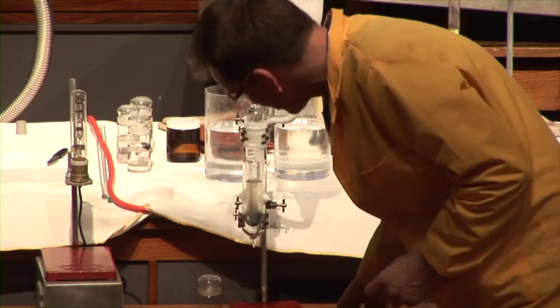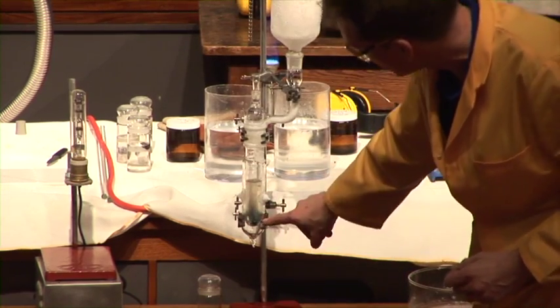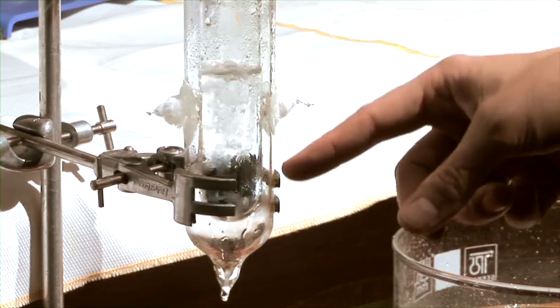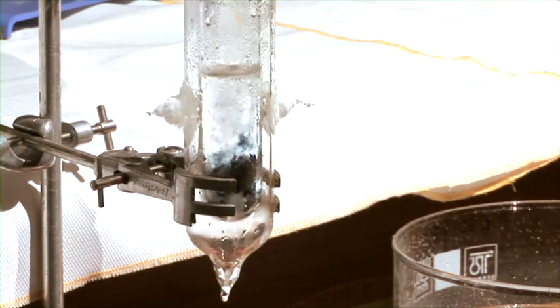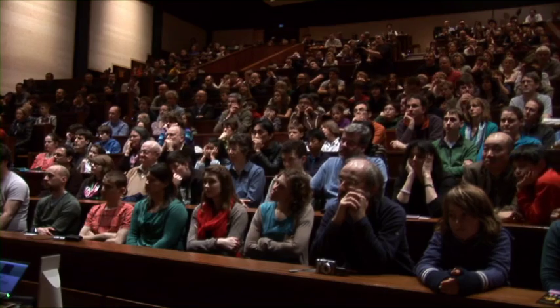It should eventually turn into a really deep blue colour all through this solution. You can certainly see it at the bottom here now, all the wisps of colour coming off of this. Just keep an eye on that, and you should see it all goes completely blue after a short time.